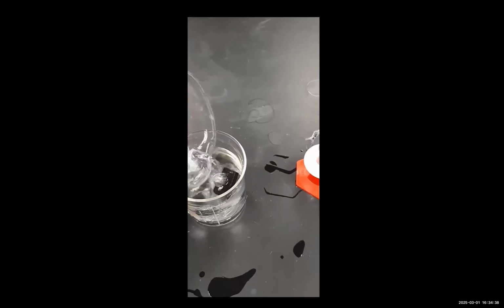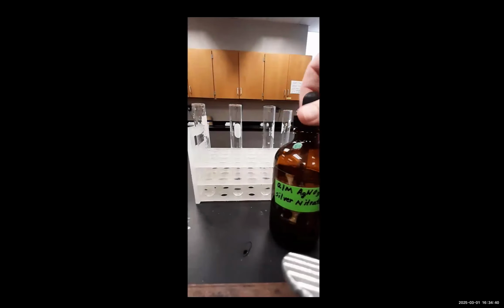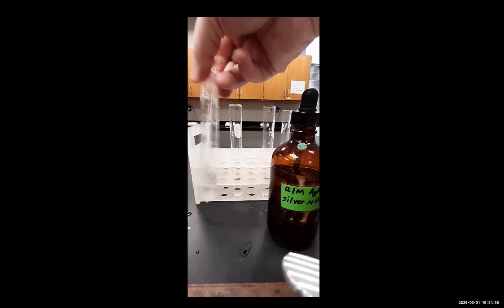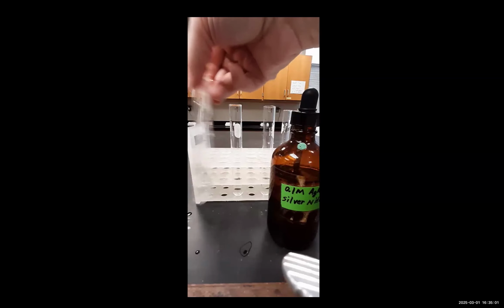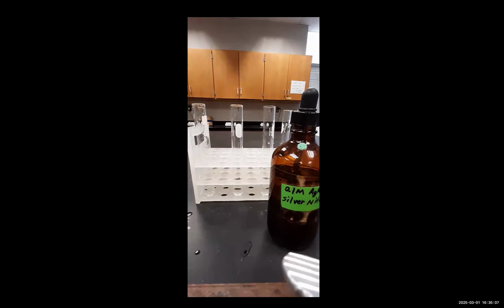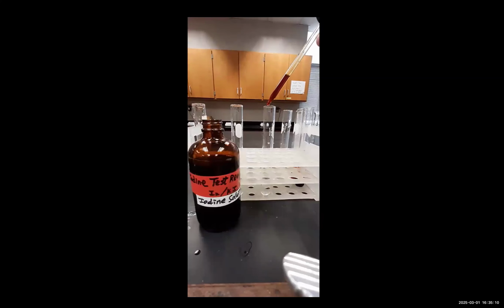Now, why do we test the water? To make sure it actually is fully deionized. Here's the time equals 0 test. So this is the water from outside the dialysis bag tested immediately. As you can see, the silver nitrate test, nothing happens, which is good. That's to be expected. If you are performing this lab in person, sometimes you can see some positive results for the silver nitrate just because diffusion through the dialysis bag is actually quite fast. So if you're not sampling the water immediately, you may see some positive results here.